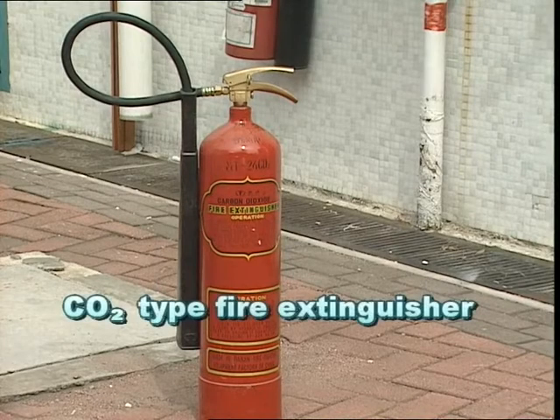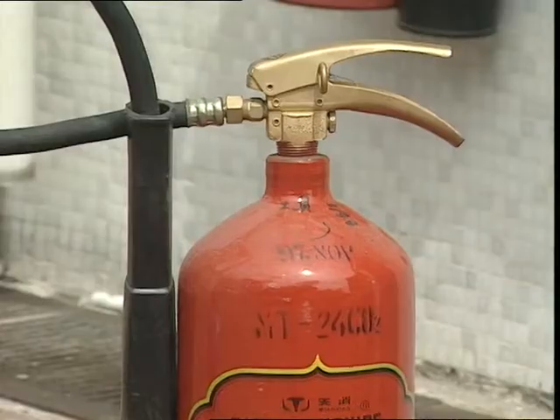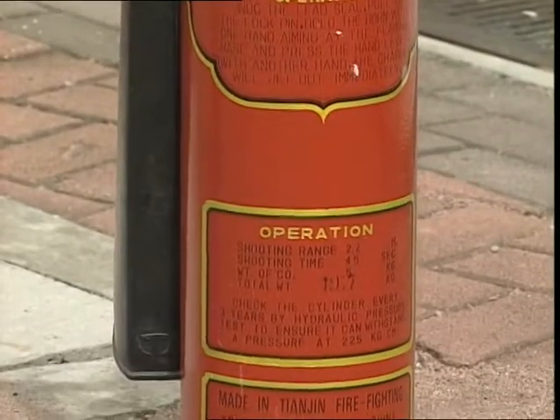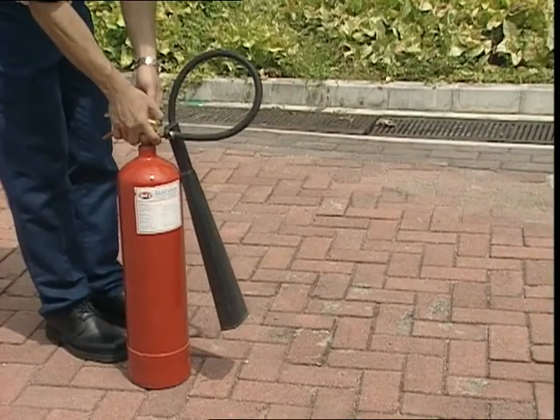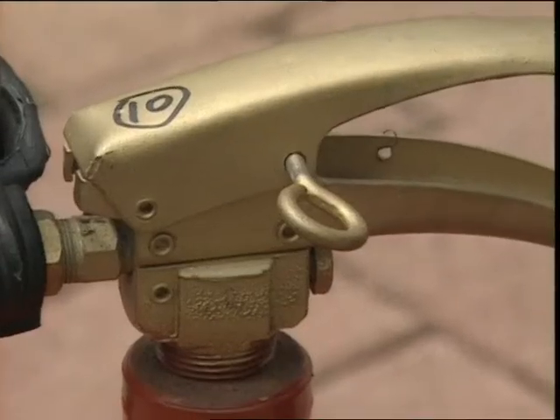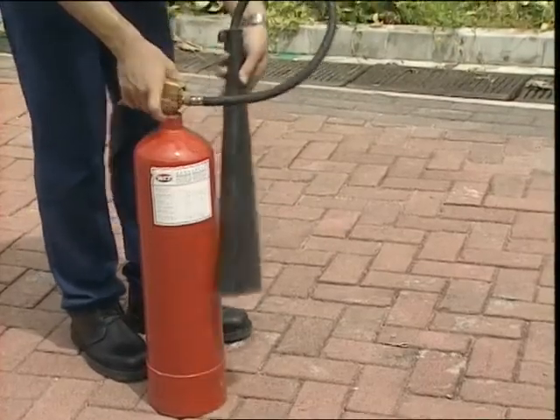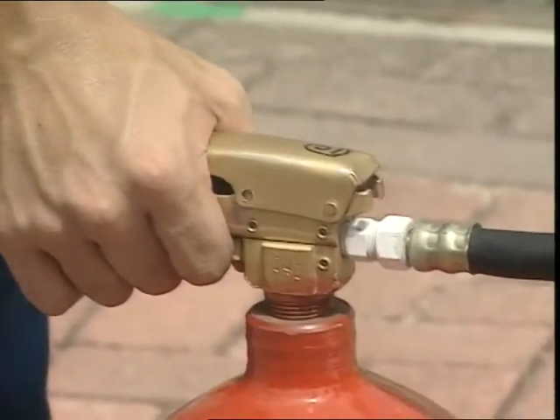The second type is the carbon dioxide type fire extinguisher, which is filled with liquid carbon dioxide. This type of fire extinguisher can be used to put out fires caused by flammable substances and electric sparks. To use this type of fire extinguisher, pull out the safety pin first, then point the opening of the extinguisher towards the fire and press the handle.